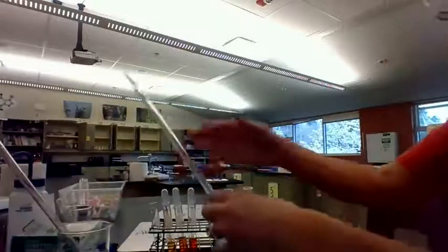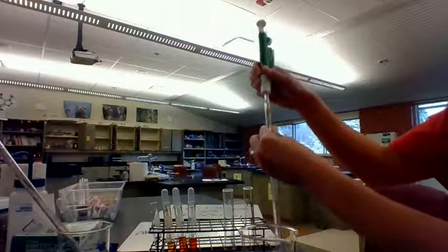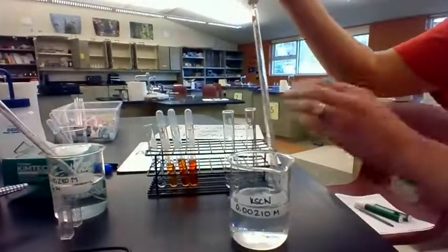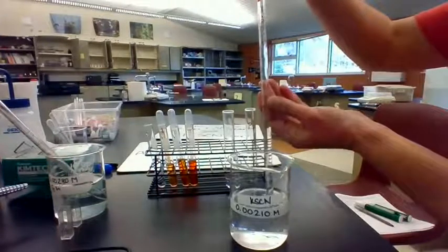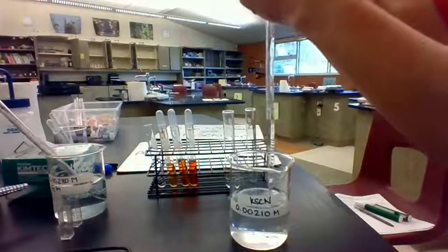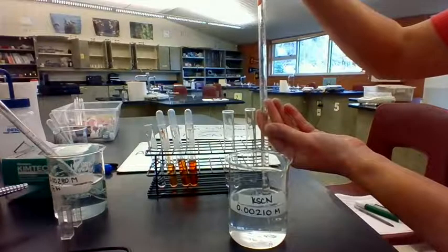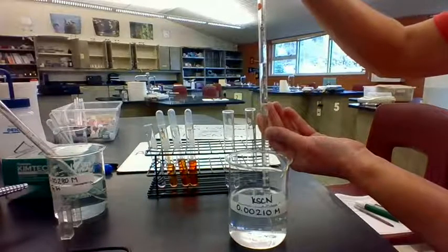And then I'm going to do my thiocyanate now. And I'm going to add 6 milliliters of thiocyanate. So I'm going to add the pipette filler, and then right here you can see that, and then I'm going to dial it up until I have this pipette filled up to 0. Whoops, I need to start over here. Sometimes we can start over. Okay, I'm going to reattach this. Okay, so I'm going to dial this up until it reaches a 0. And then I think I said I wanted 6 milliliters. So I want these solutions to add up to 10. That just makes my math easier later on.